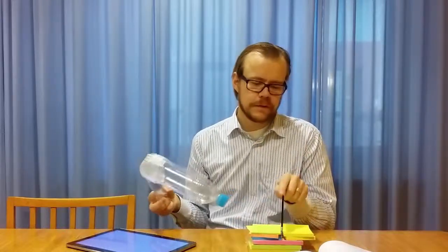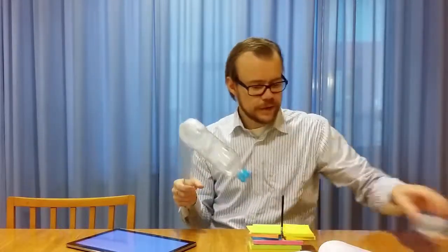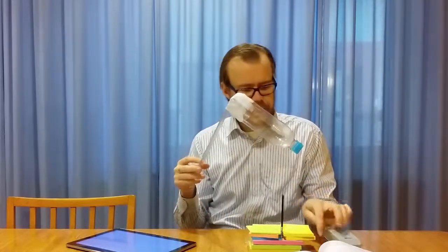So in the image, what we will see then is an image of how the tip looked like, not this small needle. So that is also an artifact. It is also apparent if you have this hole, for example, then the tip cannot penetrate down to it. It will only go a very little into it and then go over. So then you will see a much shallower pit here than that was in the real case.